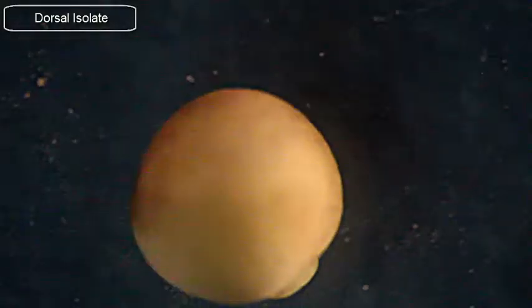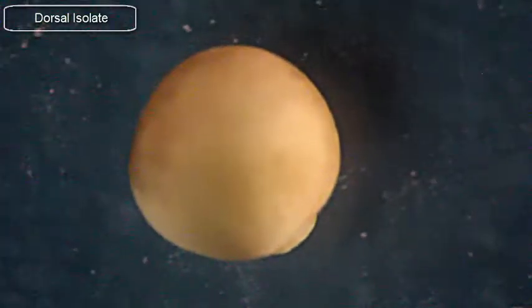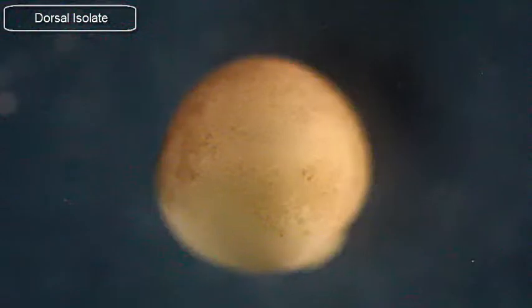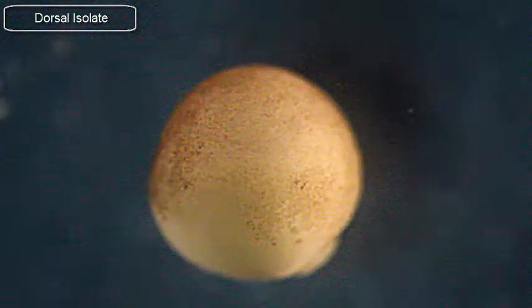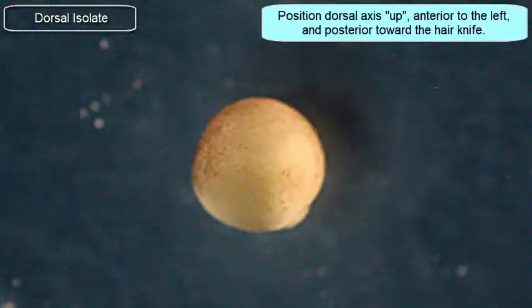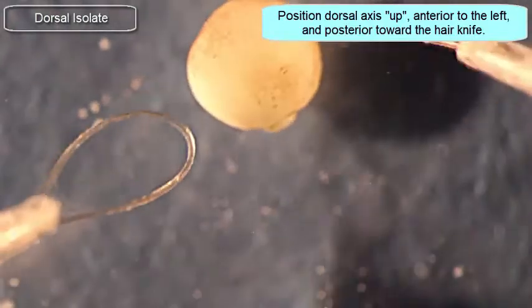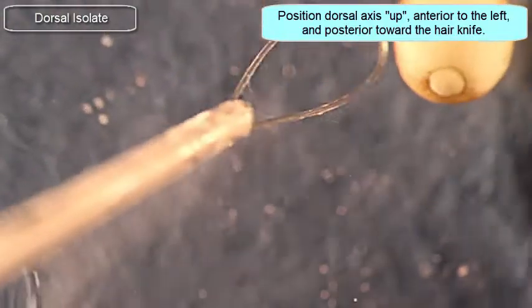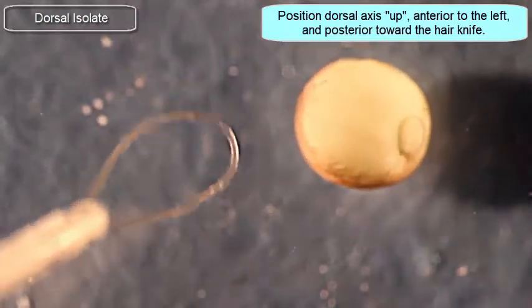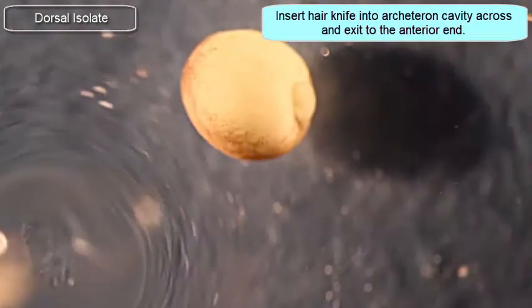This is determined by pigment pattern and a general flatness of the embryo on the dorsal side. I'll bring it into focus and roll it around a little bit. You can also find the more bottle cells on the ventral side of the blastopore. You can look at them by prodding into the yolk plug.